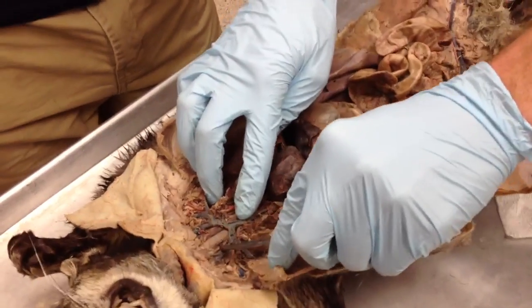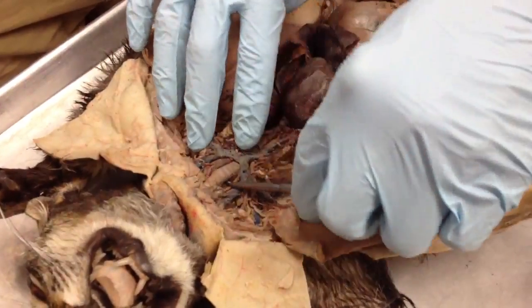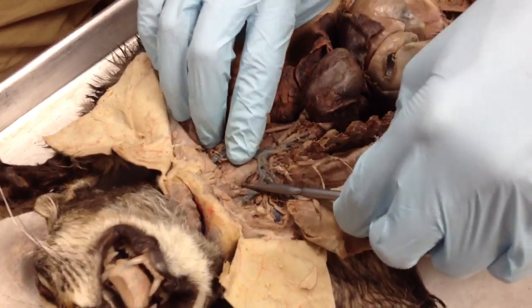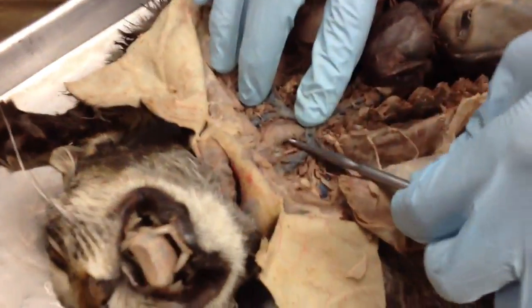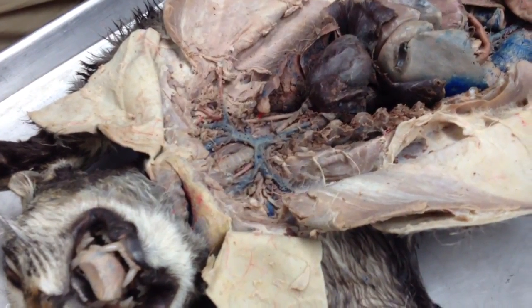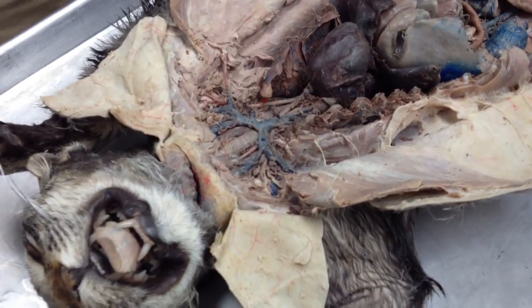That's your trachea. That's not what you need to identify for the digestive system, but what I'm pointing out is right behind the trachea is your esophagus. This guy's old and desiccated, so I had trouble finding him. So I think it's better for you guys just to know that directly dorsal to the trachea is your esophagus, and it always will be.